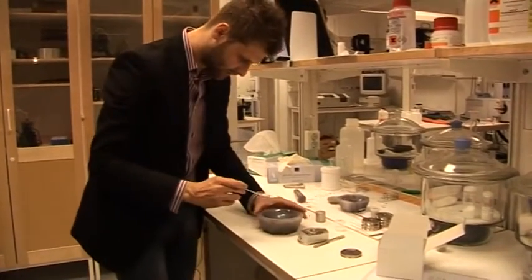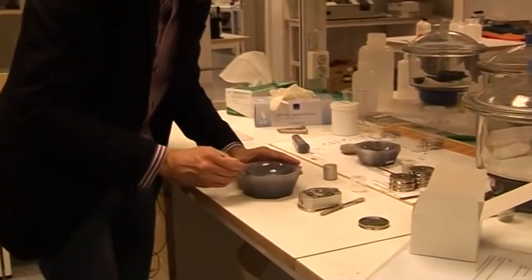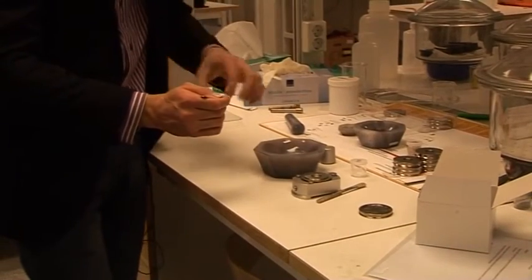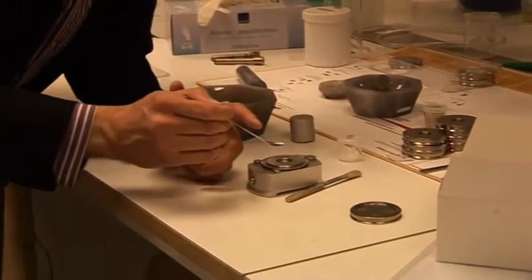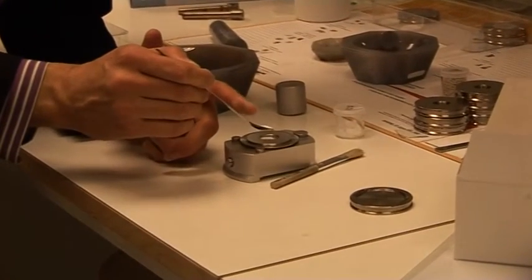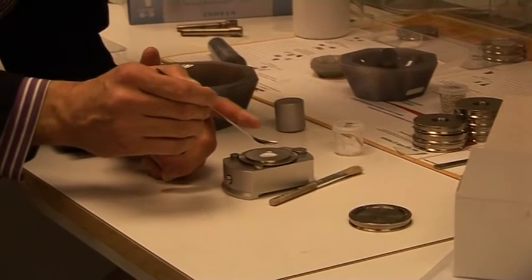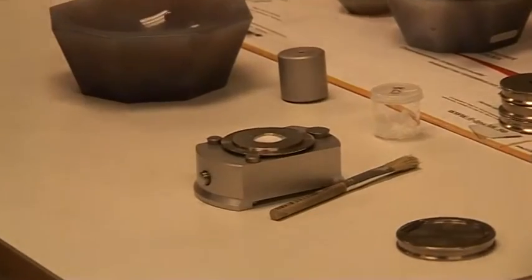Okay let's try to put it in now. I think it should be enough. So then you take it, don't take the whole spoon maybe something like that. And then carefully sprinkle inside. I usually start from the edges and then going towards the middle a little bit.